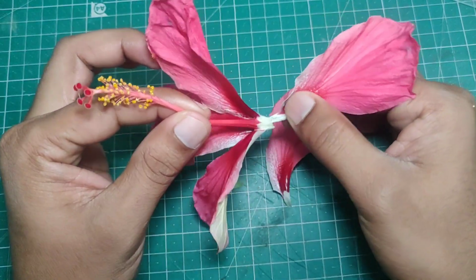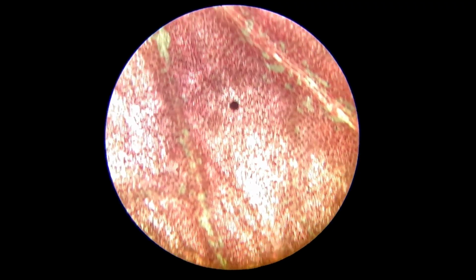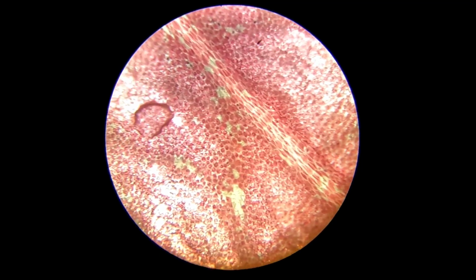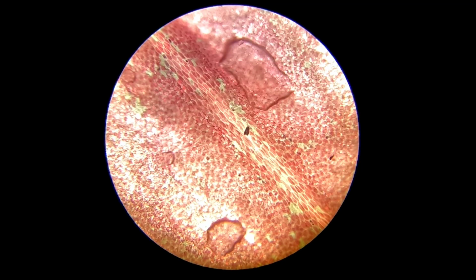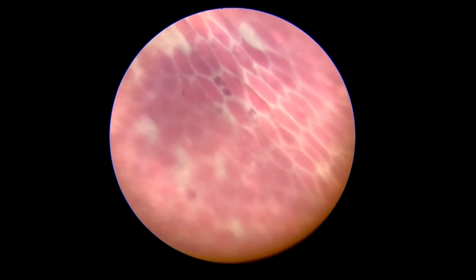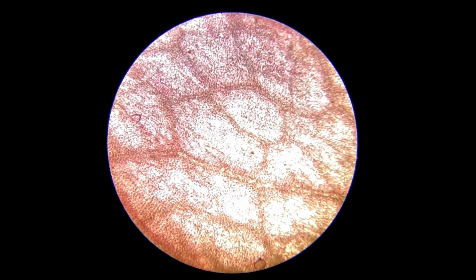Now let's take one petal and place it on a glass slide. This is hibiscus petal under magnification. Take a moment and let your eyes adjust. What looks smooth before is actually full of texture. You can see tiny cells arranged like tiles. You can see uneven surfaces and fine structures. What looks flat to our eyes is actually three-dimensional. Each of these cells once grew from a single point. Light reflects differently from each surface, and this is what gives petals their glow. Nature doesn't use paint, it uses structure. Imagine how small these details really are.